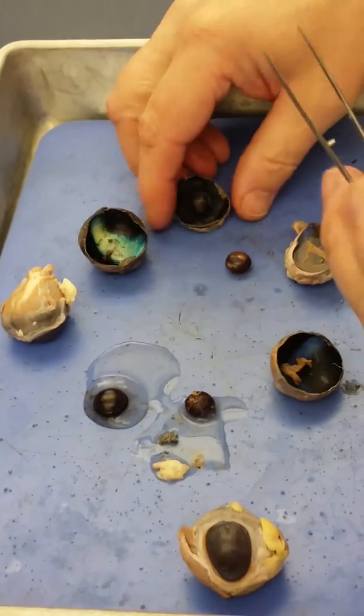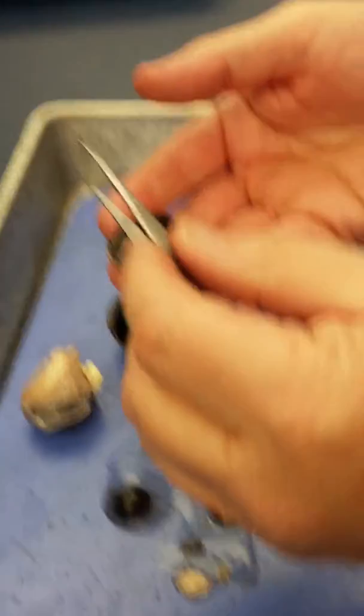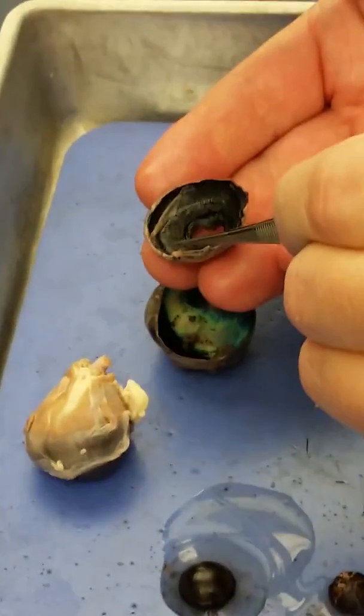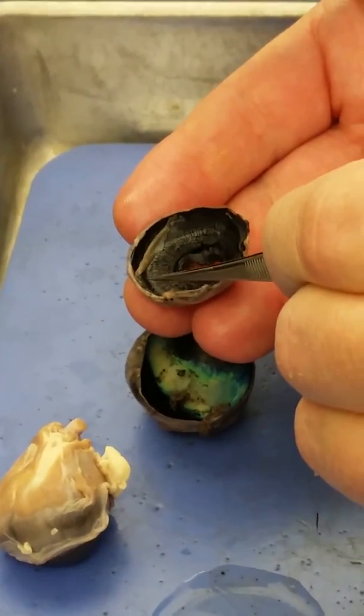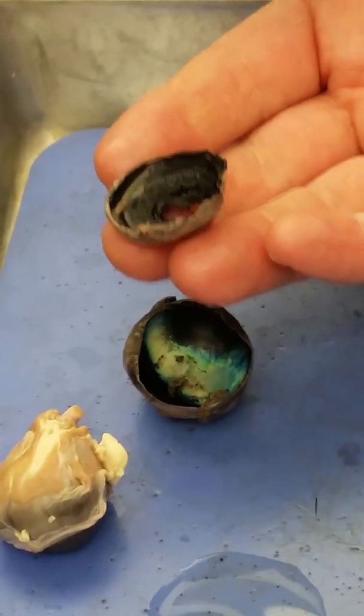Back here to the, one thing I forgot, back here to the ciliary body, you can see that it's corrugated, like corduroy, and the edge is serrated. So the edge is given the name ora serrata. Ora means around, serrata means saw-like.